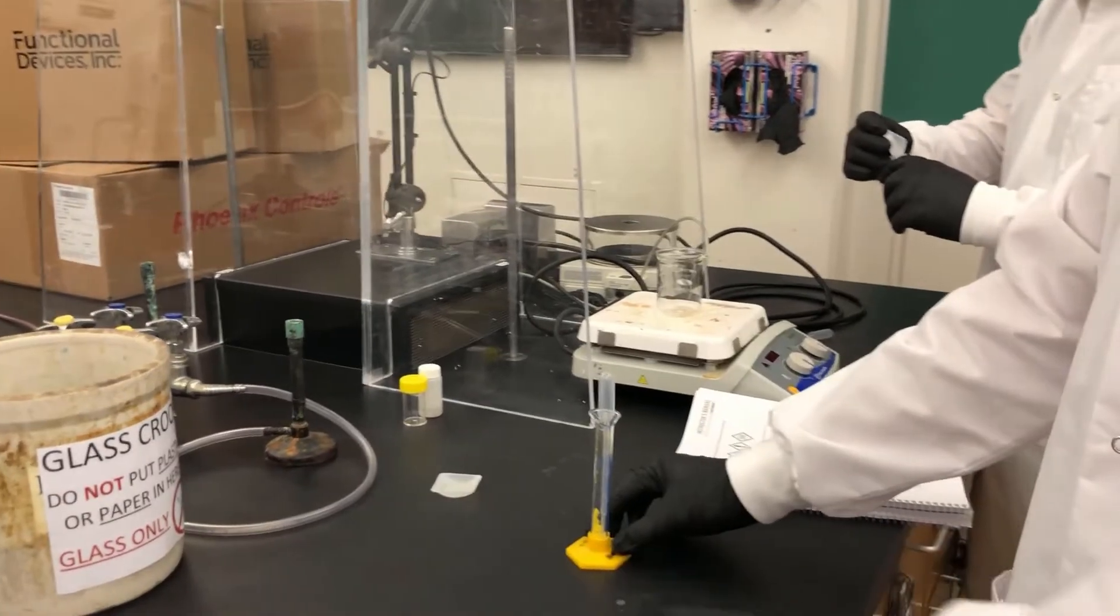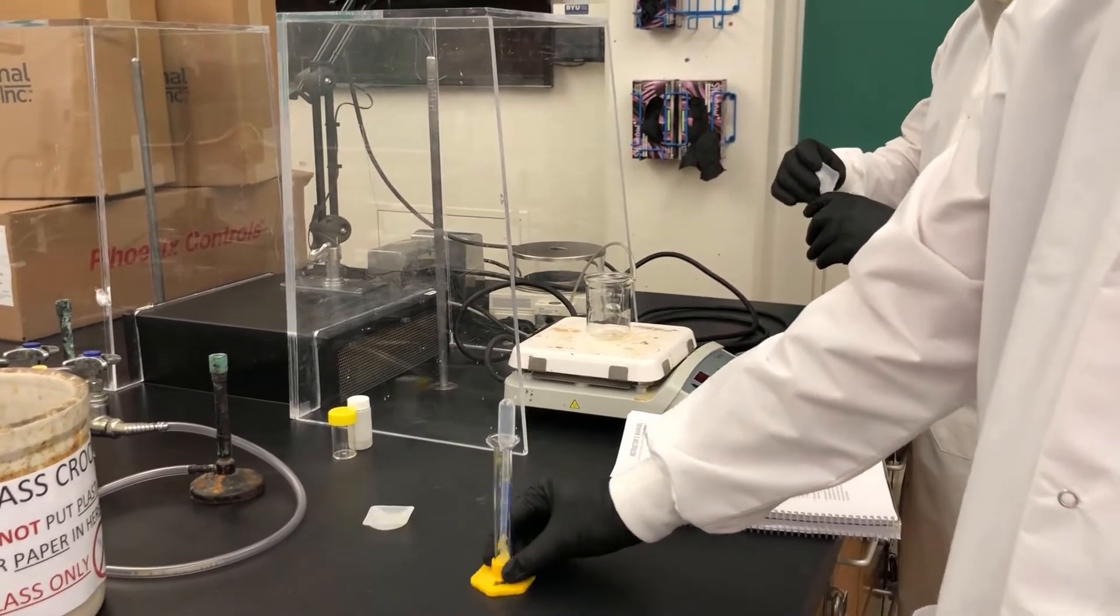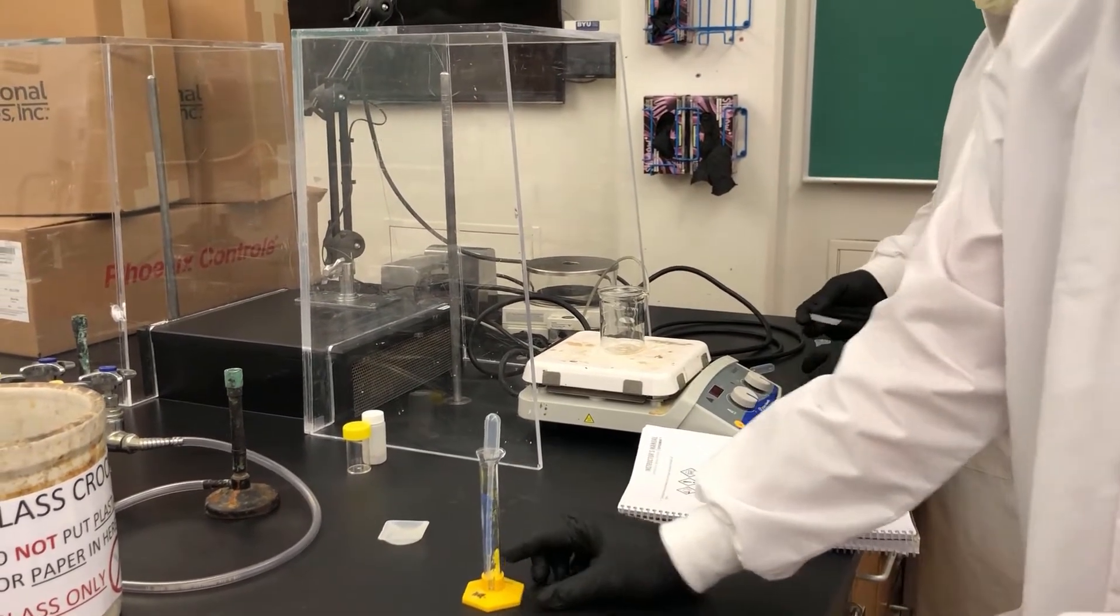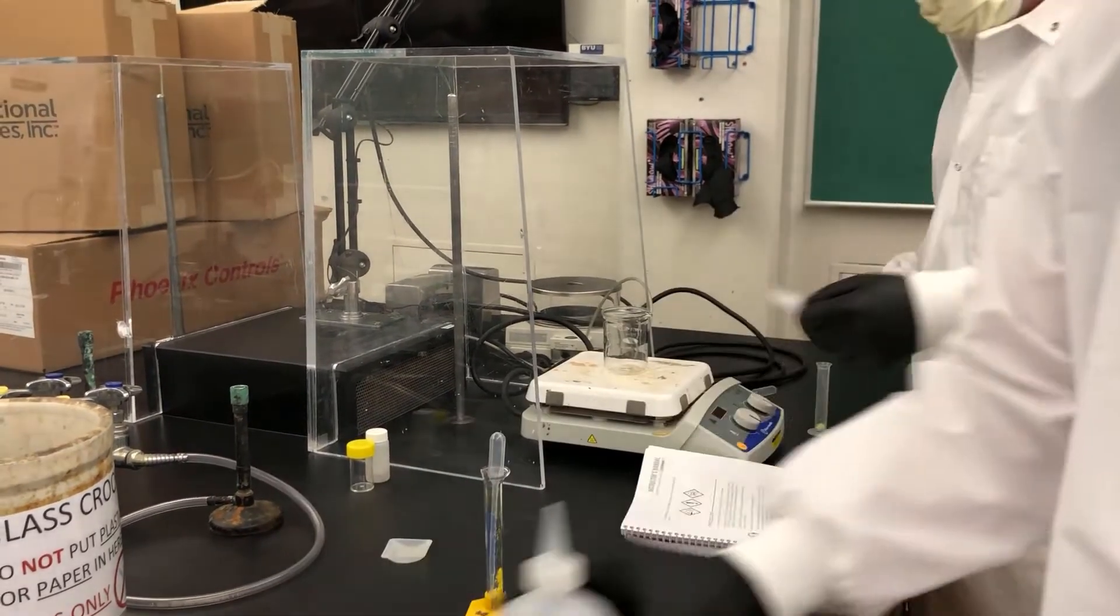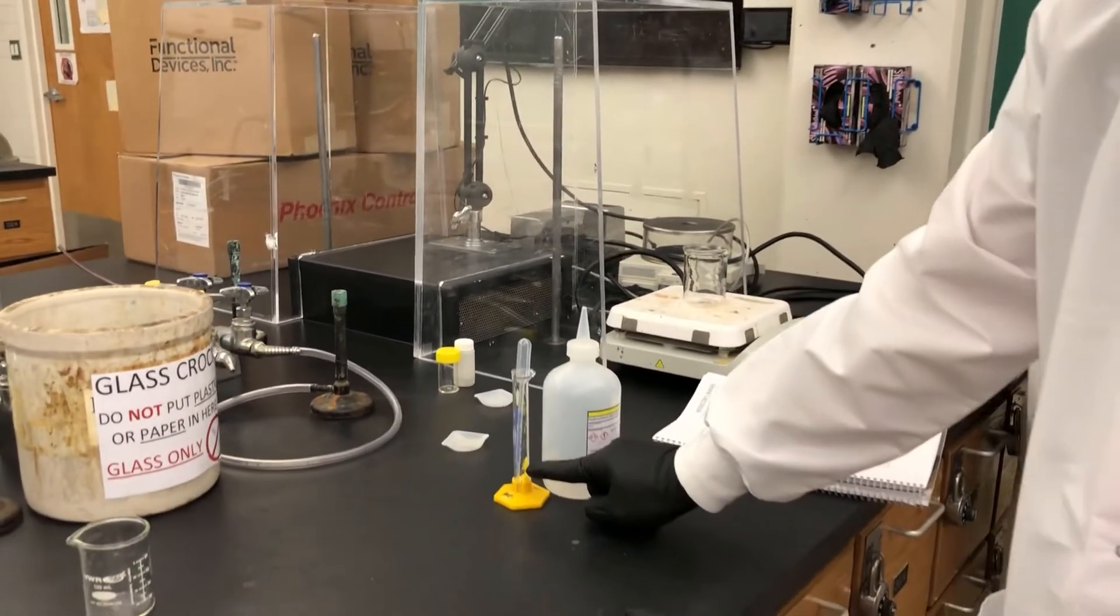Now, since I need to have 4 milliliters of this solution, I'm going to add my hydrochloric acid up to the 4 milliliter line here.